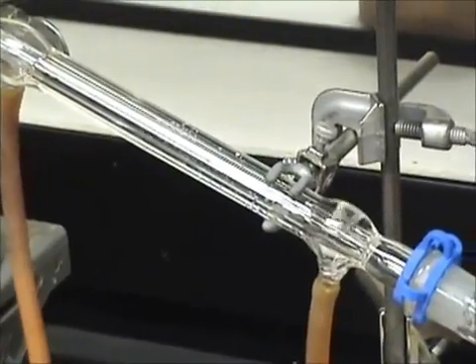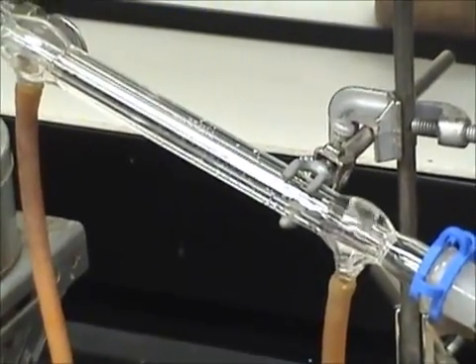Distillation will start and condensate your desired product into the receiving flask. There you have it, the proper technique to set up a simple distillation. Good luck and happy distilling.